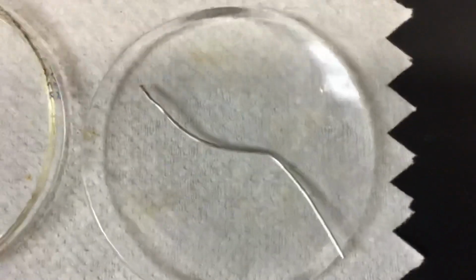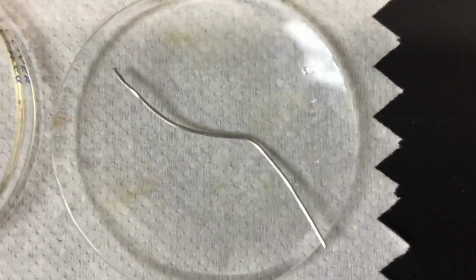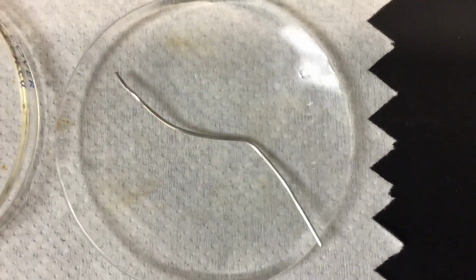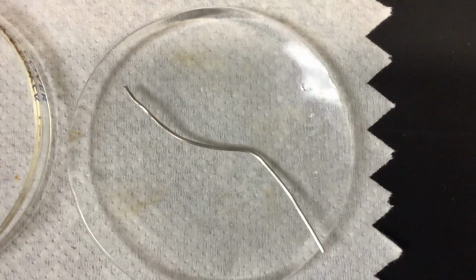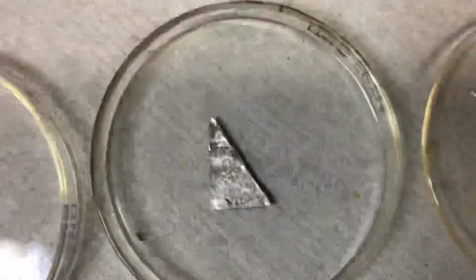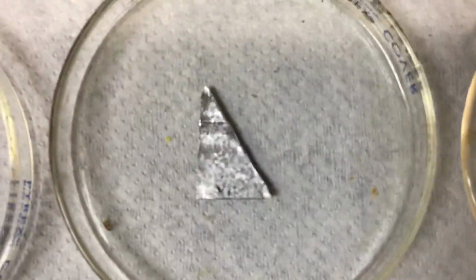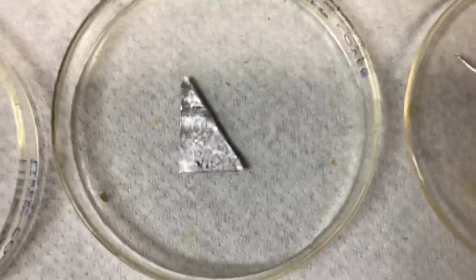So this very first one that you're going to see, this is aluminum. So record the appearance of what you think the aluminum looks like. What are the properties that I just went over? What do you think you can identify aluminum as in terms of what the property looks like? Okay, this is tin. That's the next one. What is the appearance of this tin when you look at it?